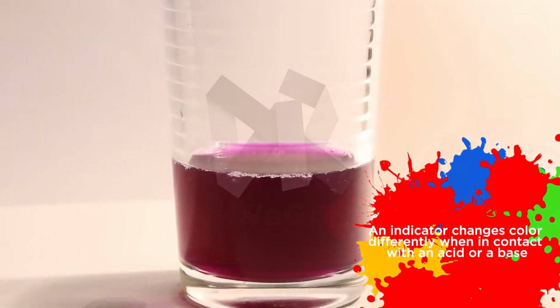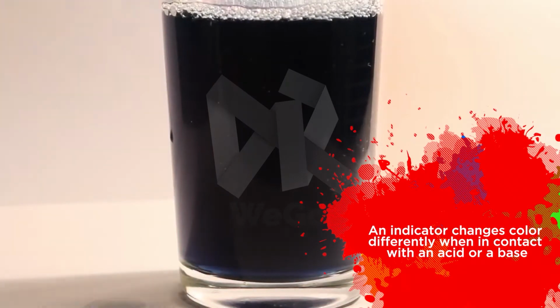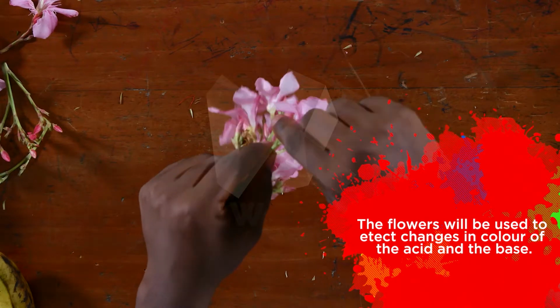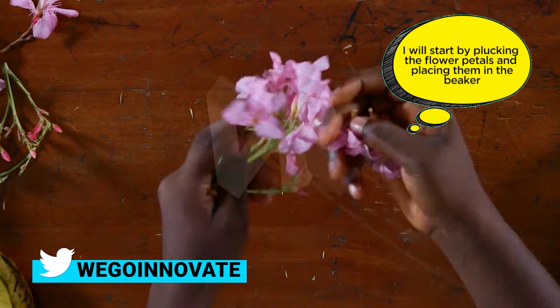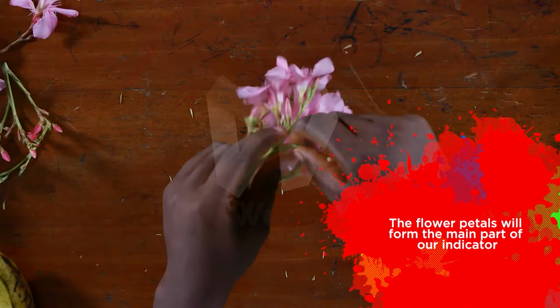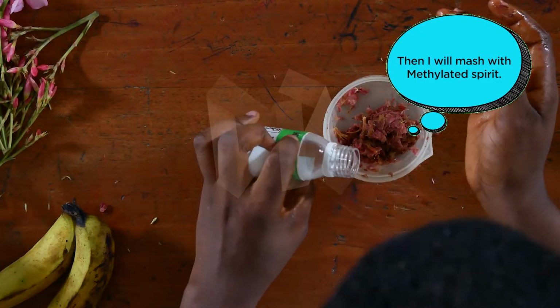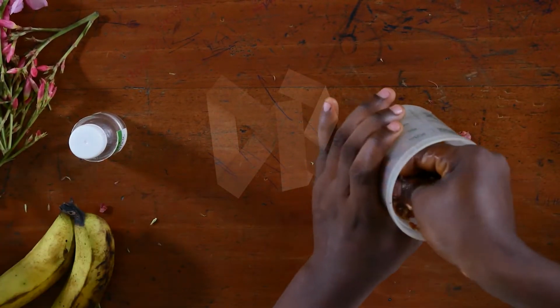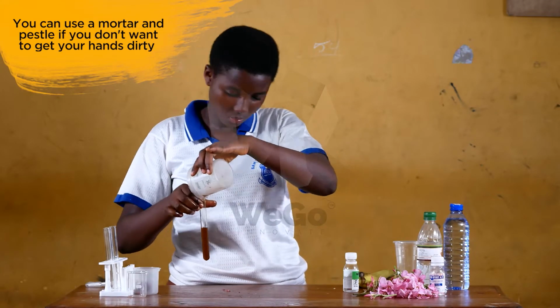An indicator changes color differently when it's in contact with an acid or a base. The flowers will be used to detect the changes in color of the acid and the base. To begin, I will start by removing the flowers into the beaker. The flower petals will form the main part of our indicator. Here I'll mash with methylated spirits. The methylated spirit will bring out pigments of the flower. You can use a mortar and a pestle if you don't want to get your hands dirty.